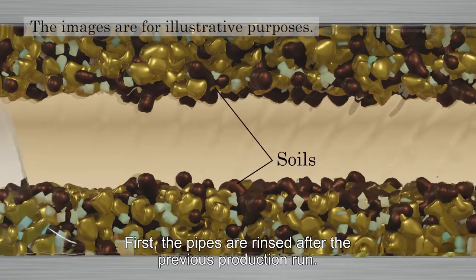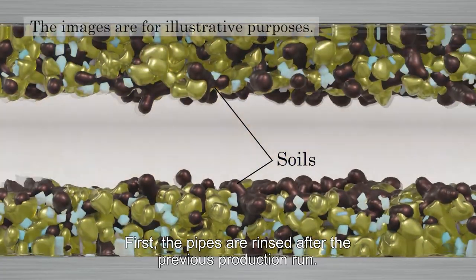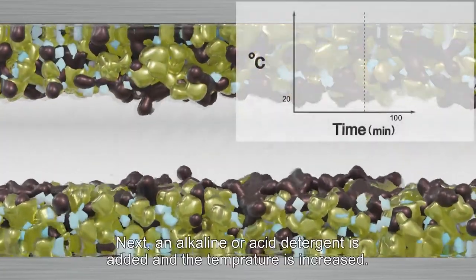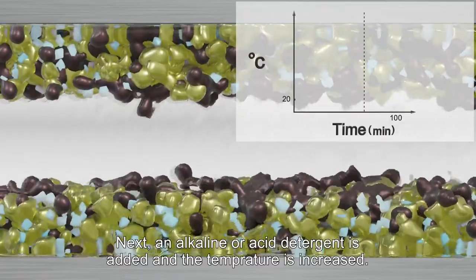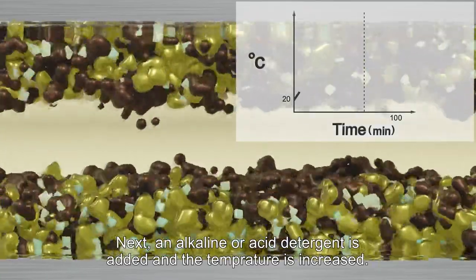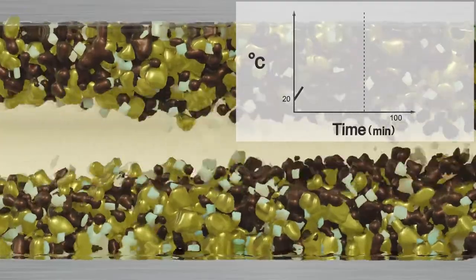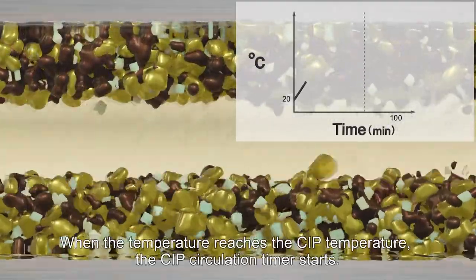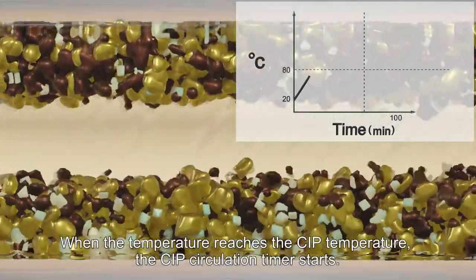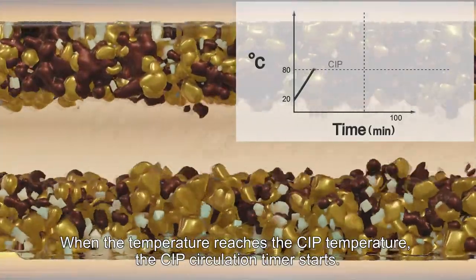First, the pipes are rinsed after the previous production run. Next, an alkaline or acid detergent is added and the temperature is increased. When the temperature reaches the CIP temperature, the CIP circulation timer starts.